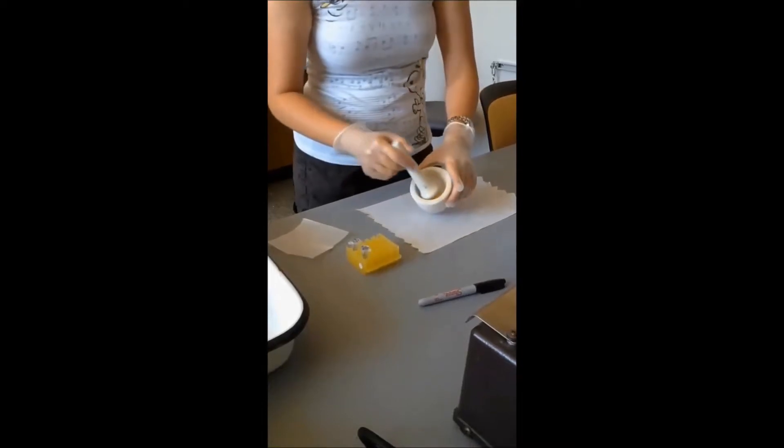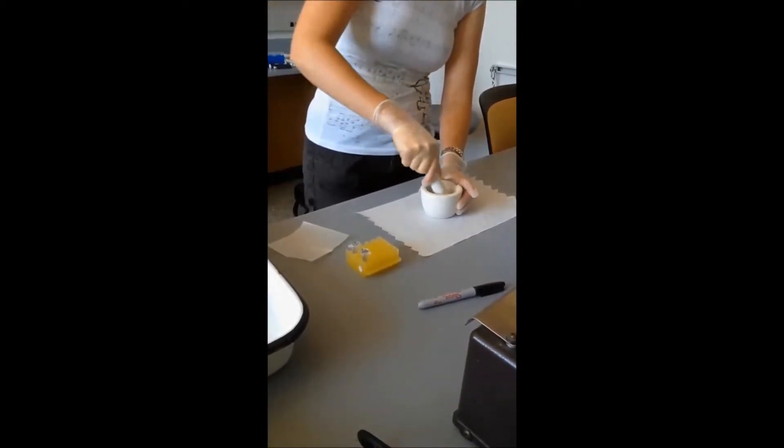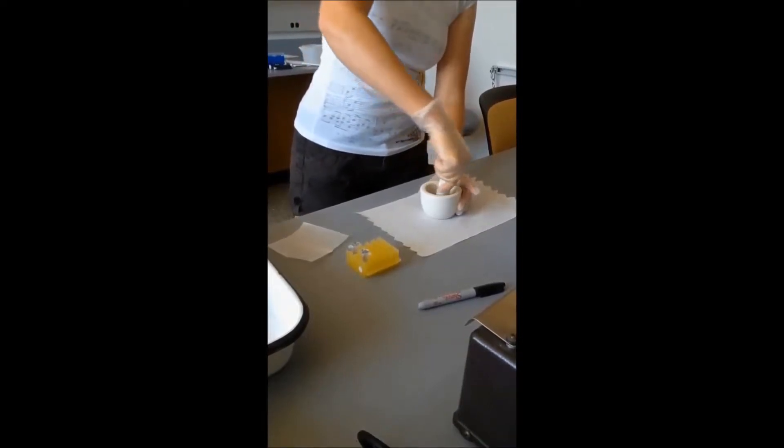So it looks slightly powder-like, and then it'll be easier to grind into a super fine powder. The herbal supplements start as a powder to begin with, so you just want to make sure you thoroughly press down hard and grind the sample.